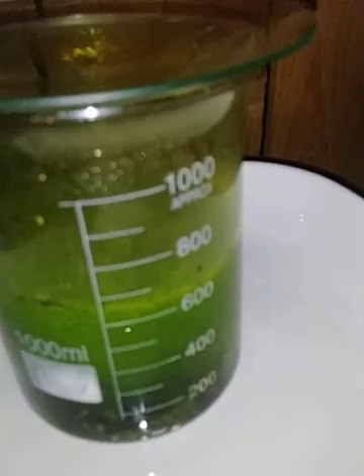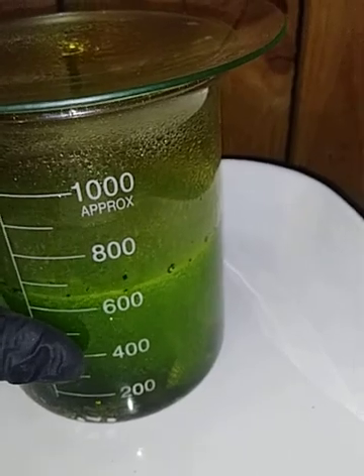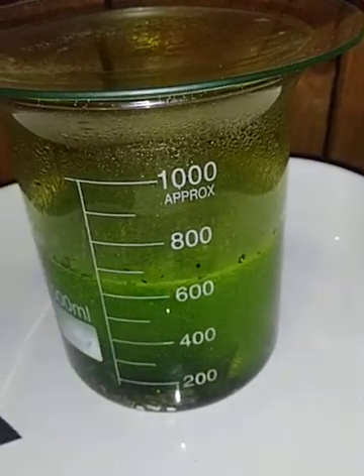The reaction is now hot enough to make a very nice aqua regia solution. Watch glass always in place — sizzling away now. Since pausing I added a total of 20 milliliters nitric to 600 milliliters of HCl, and I'll let this thing cook away for a while. The plate is hot to the touch. I'll make sure that red light doesn't come back on — if it does I'll turn it down. I'll be back.